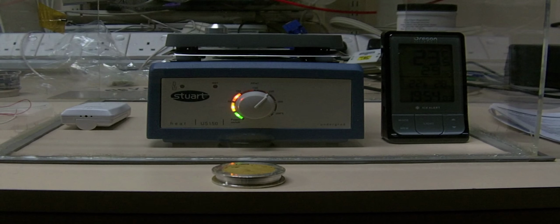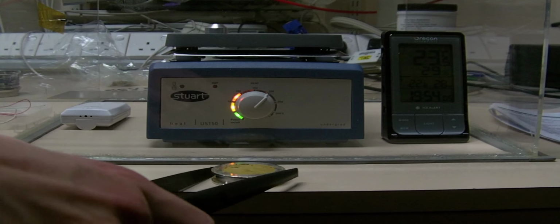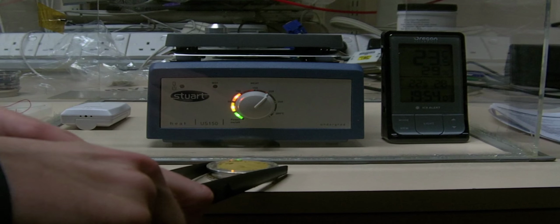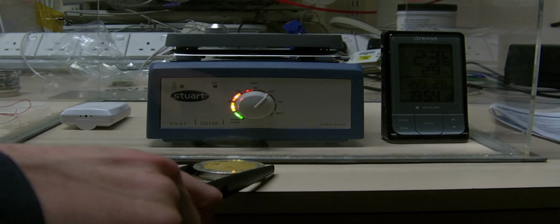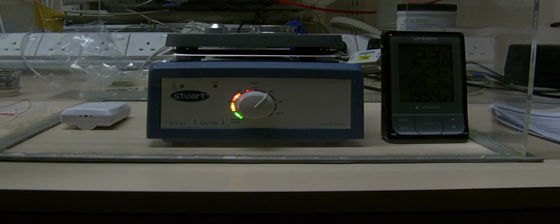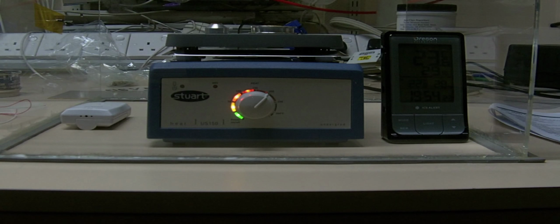Gotta do this quick, because remember, nitrogen atmosphere inside. Okay, that's the first one in there. Now, to get the larger one. Got to be careful, don't want to tip this one up. Okay, again, as quick as possible. Right, there we go. And it's alright because I can always increase the flow rate if I want to replenish the nitrogen in there, because it's going to be in there for about 3-4 days now.